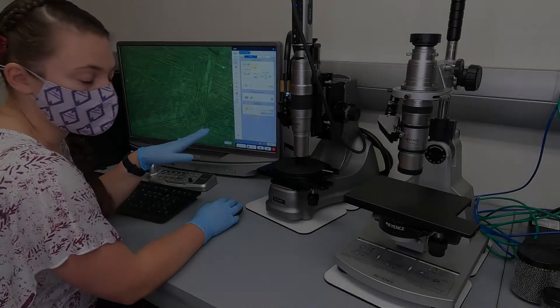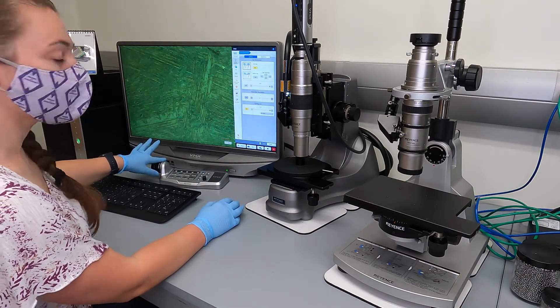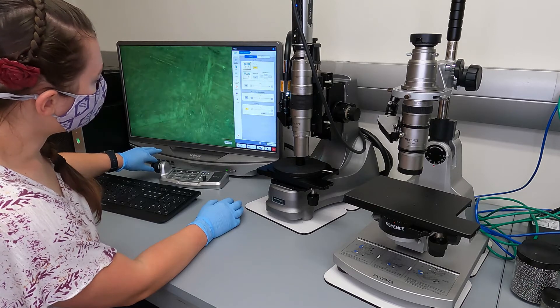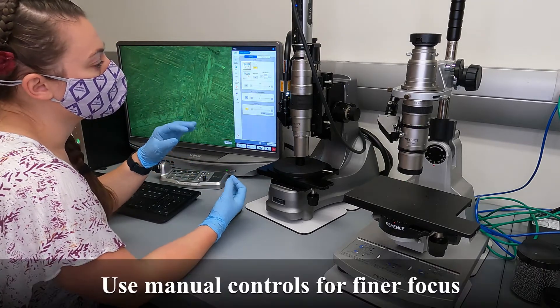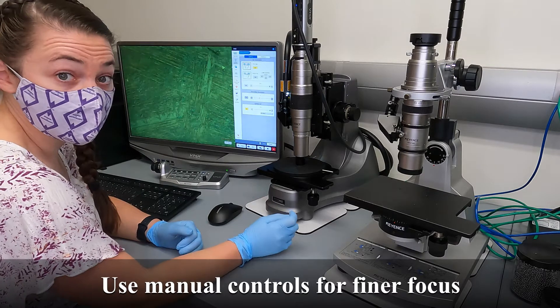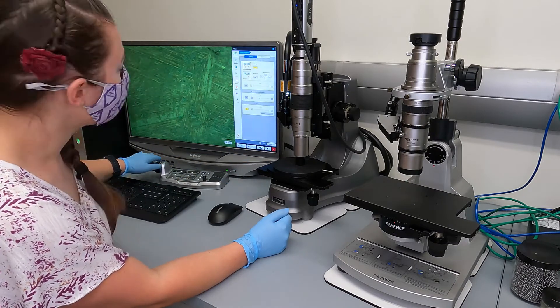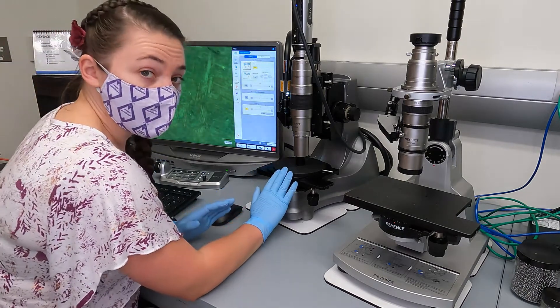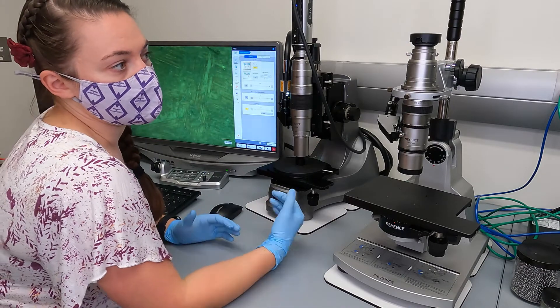Now we're able to control the Z-axis through the software. We can use the console to do that — there are two knobs on the left-hand side: the bigger one is the coarse focus and the smaller one is the fine focus. Note that these are motor steps, and since the motor steps are not that small, you'll get greater control using the continuous focus knobs on the machine itself rather than the console. The console knobs are helpful for getting close to where you're going. This is only for the automatic stage — if you're on the manual stage, you need to focus fully using the dials on the side of the stage.